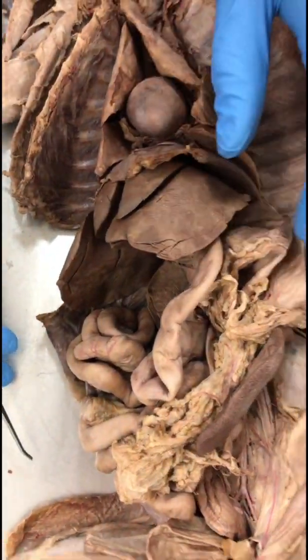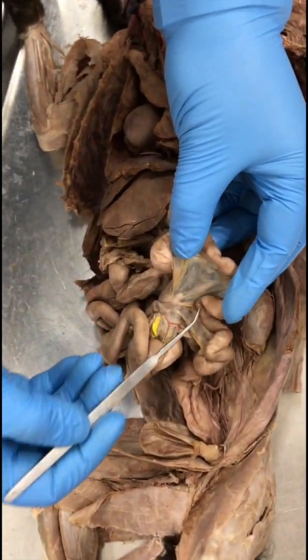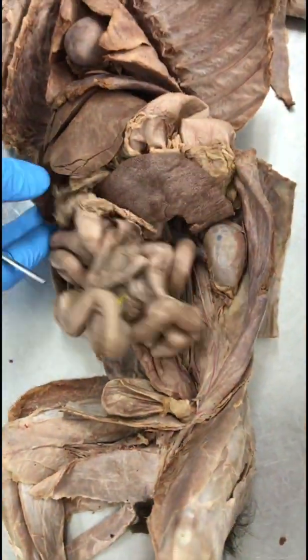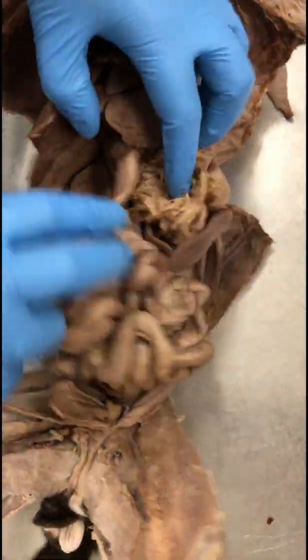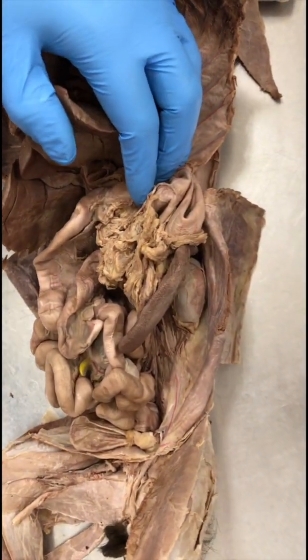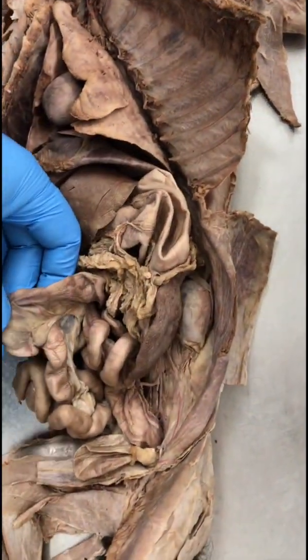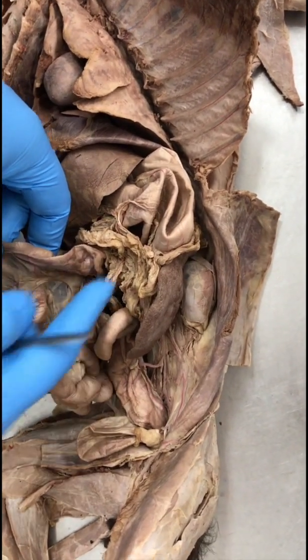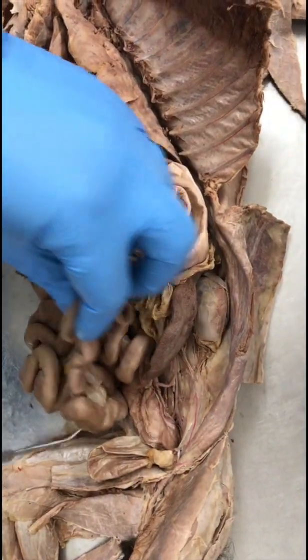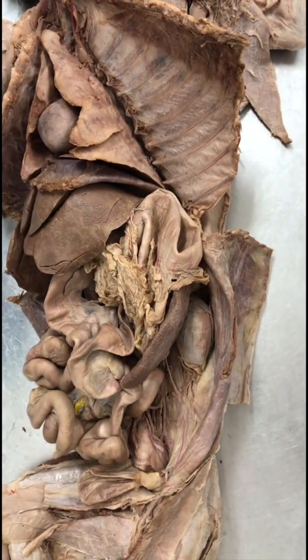Okay. Mesentery. Those are these thin membranous structures inside the small intestine. So all these are mesentery. Small intestines. The first part is duodenum. So the stomach. Anywhere else on the curved part is jejunum. But if you're able to see the large ascending colon, the small intestine that goes into the ascending colon is the ileum. Okay, so ileum, jejunum, and duodenum. Okay, 3 parts of the small intestine.